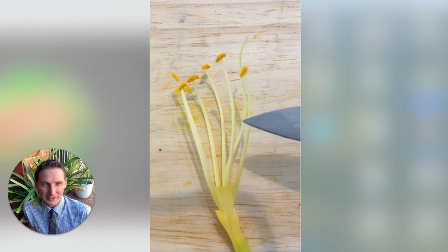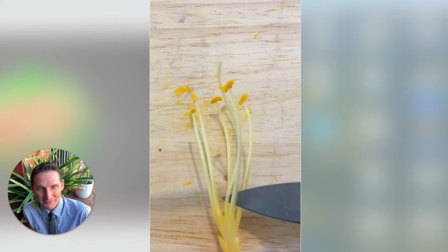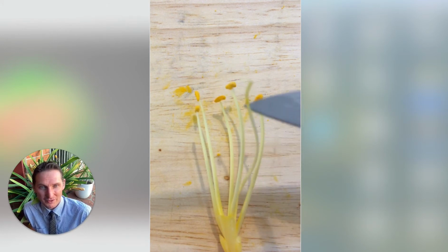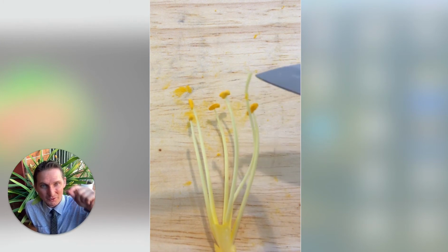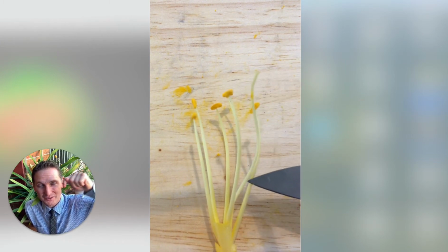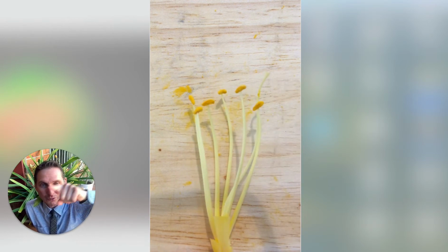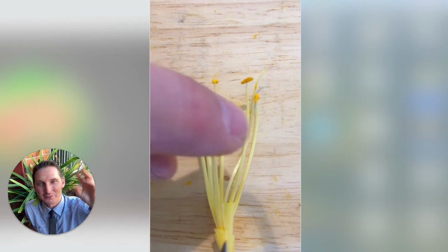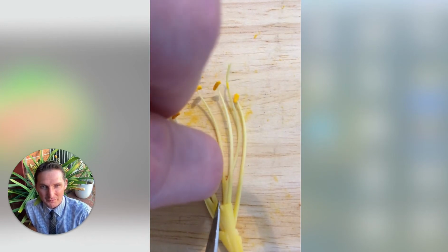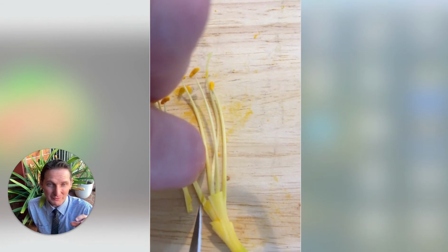And then what I'm pointing at now is the one that doesn't have that red, yellow thing at the top, and that is the female part of the plant. And you can see as I work down and bring it forward, that doesn't have anything at the top, and it's actually got three little additions to the top as well. So that's the stigma at the top, the style, that long tube as well. And then if we go all the way to the bottom where my finger is, that's where the ovule and the ovary is.